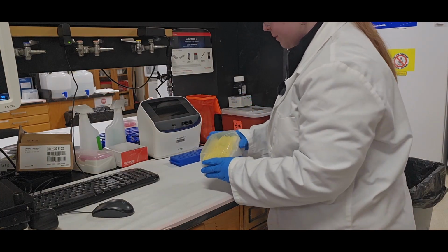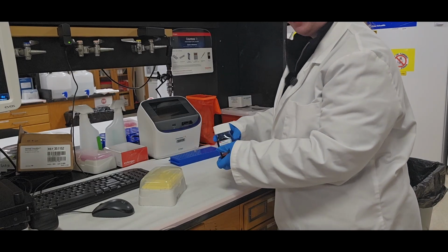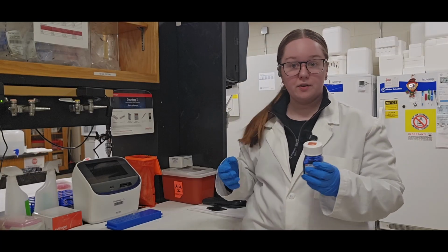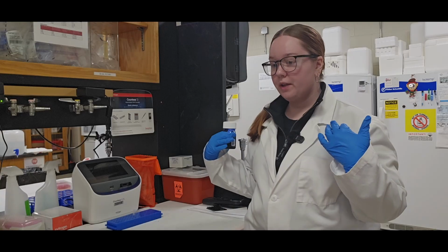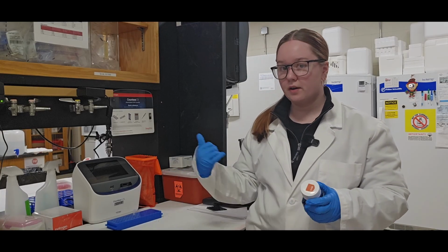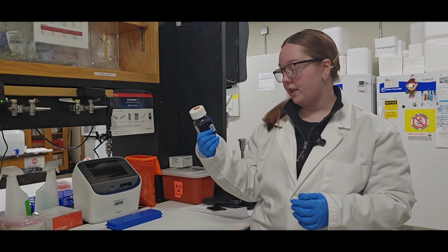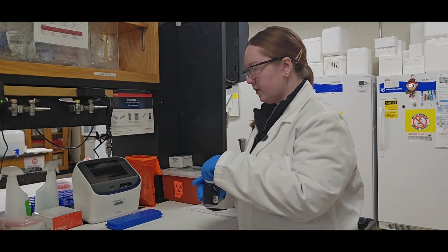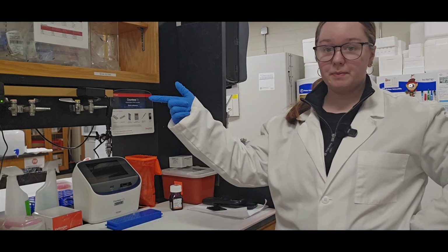I need yellow pipette tips. I will also need Trypan Blue, which is just kept here for use. This Trypan Blue is not sterile. It's kept and used outside of the biological safety cabinet. But you still want to be wearing PPE while you're doing this whole thing, because the cells are a biosafety level 2 hazard. This Trypan Blue is a carcinogen and a mutagen, so you don't want to get this on your skin. You'll also need a micropipette, which is located on the opposite side of this bench.